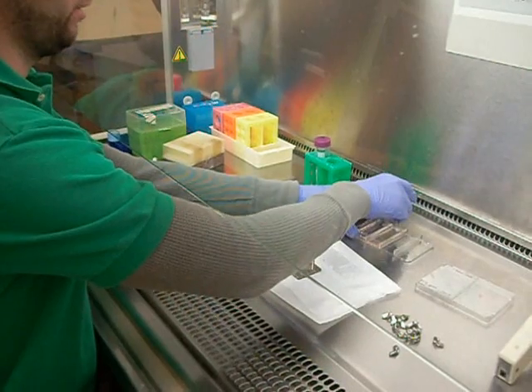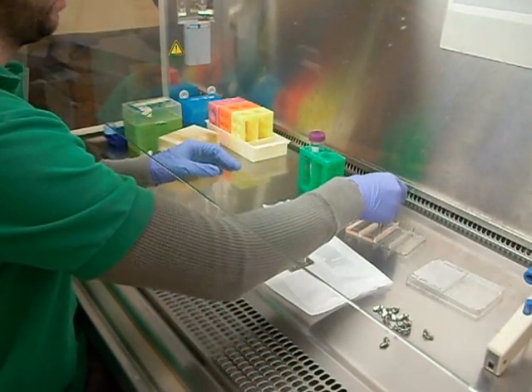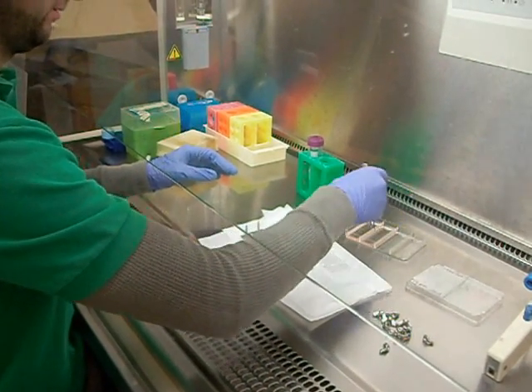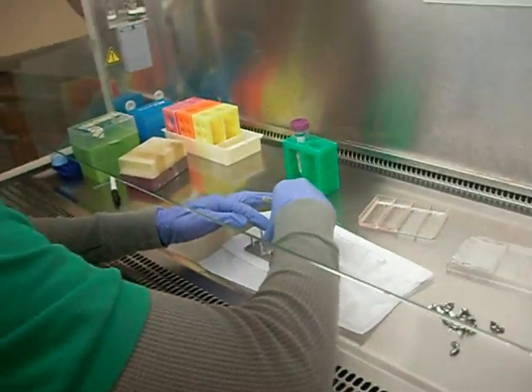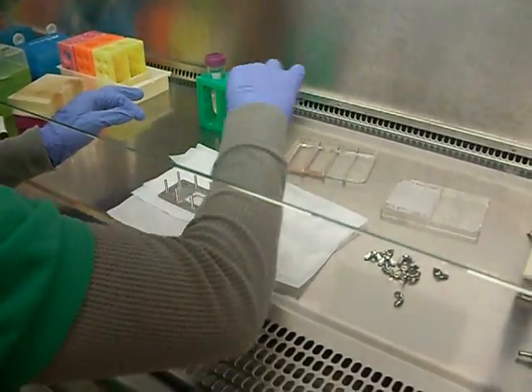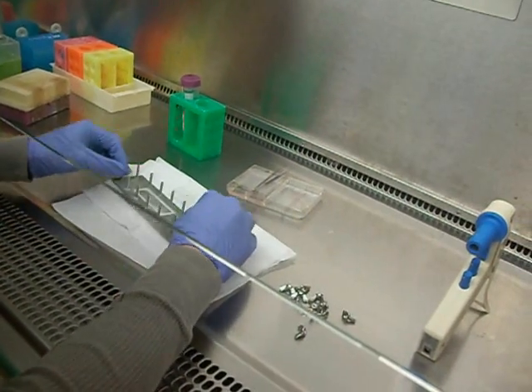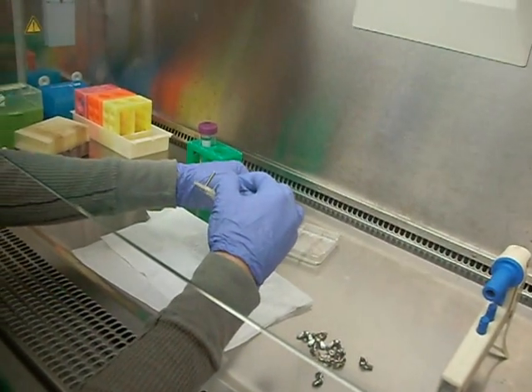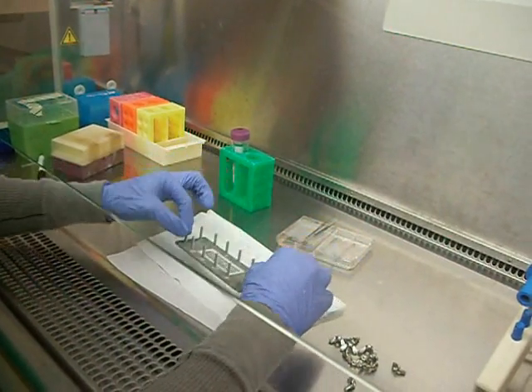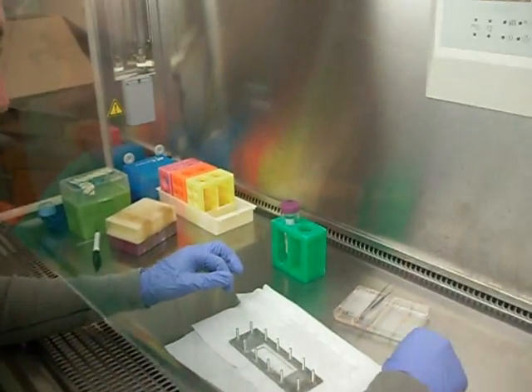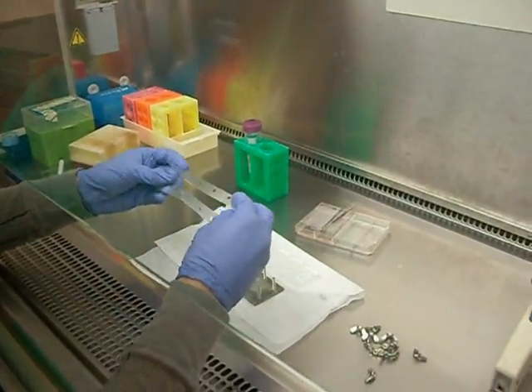Here's our slide that we're going to use with the cells. We fit it into the chamber. And then what you want to do is always take a look at it to make sure that it's sitting evenly and flat in the chamber.